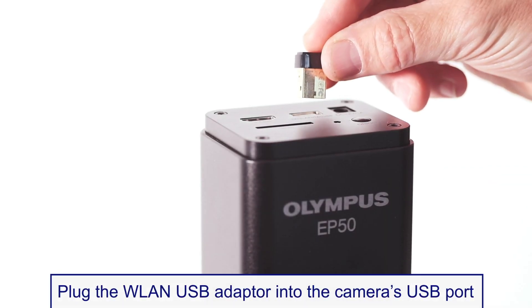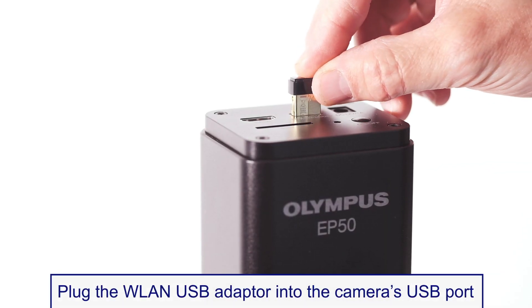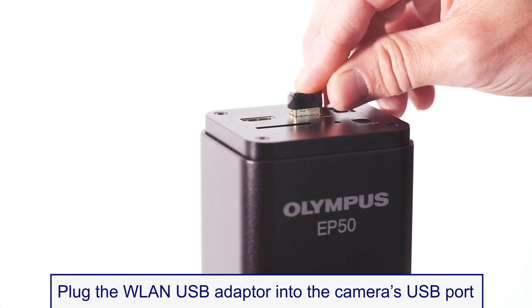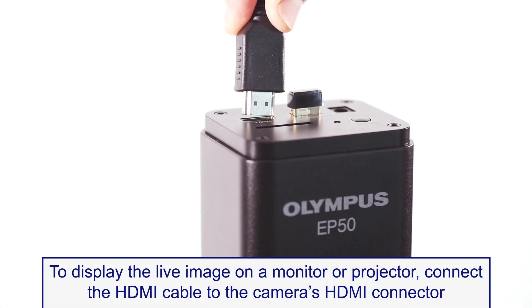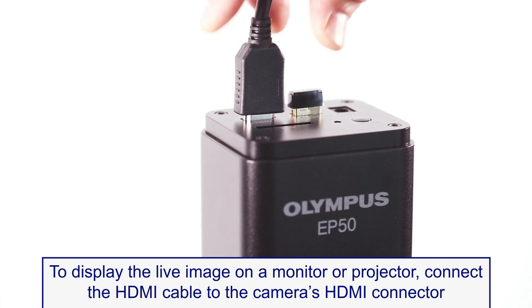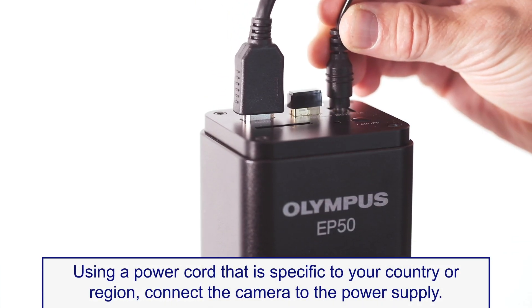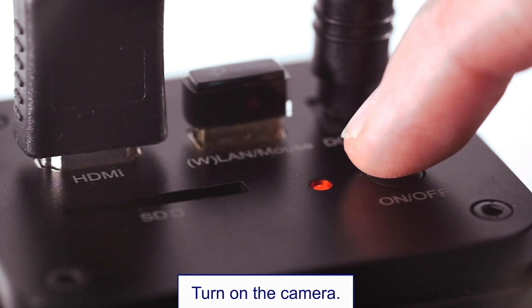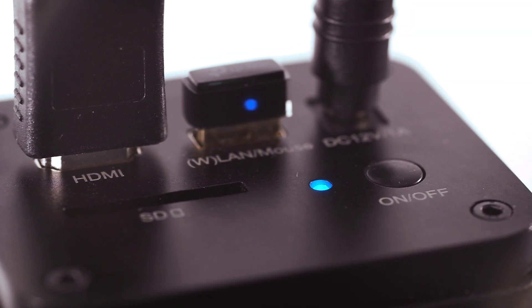Now, plug the USB WLAN adapter into the camera's USB port. If you also want to display the live image on a monitor or projector, connect the HDMI cable, then plug in the power supply cord and turn on the Olympus EP50 camera.